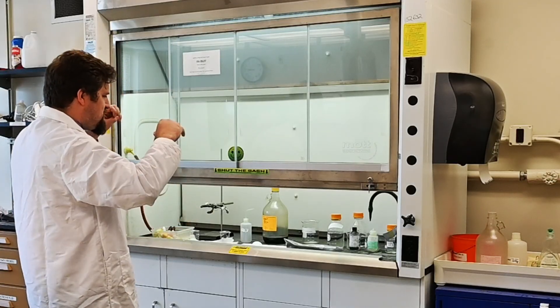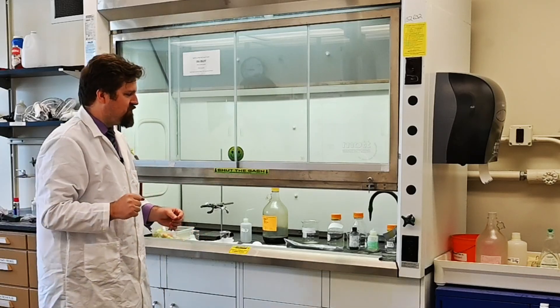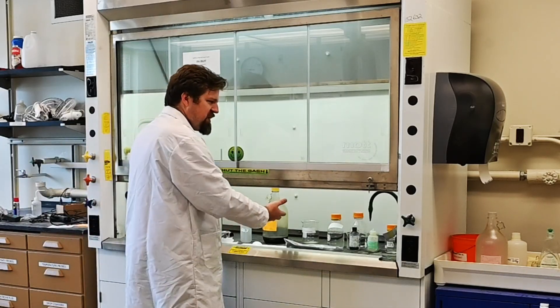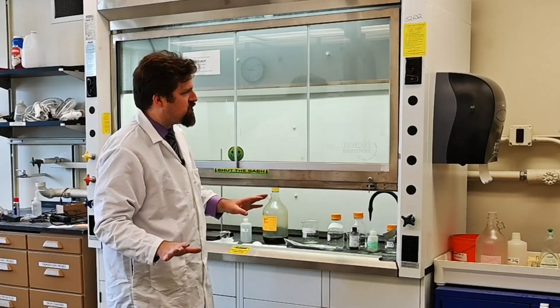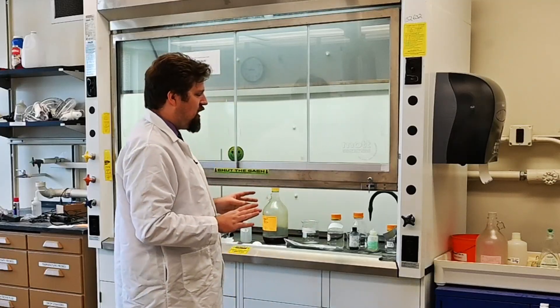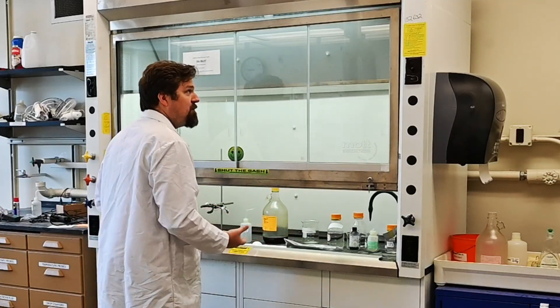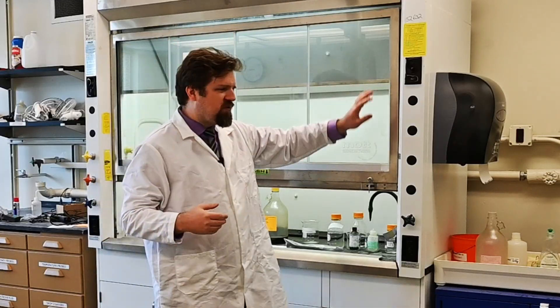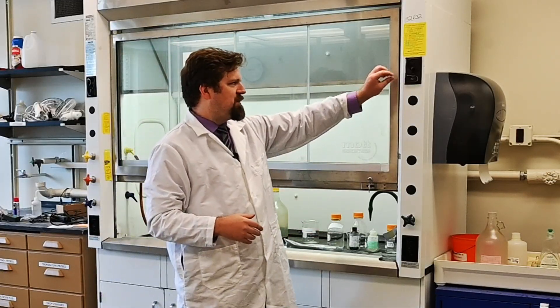If you're working with something that's incredibly volatile — something you don't want even a whiff of — then you will work with it inside the fume hood. Keep in mind a few things: you do need to turn the fume hood on. When the fume hood is on, you can probably hear it drawing air up and taking it to the roof. If there's anything in there that you're working with that is open, you really should keep it on.